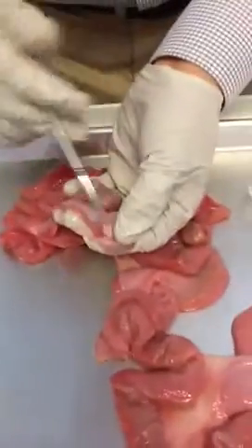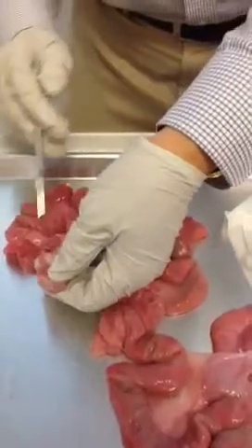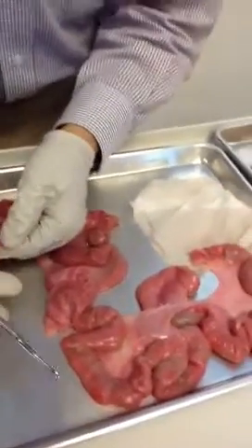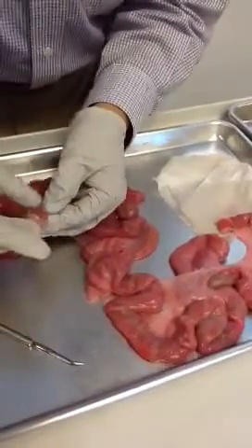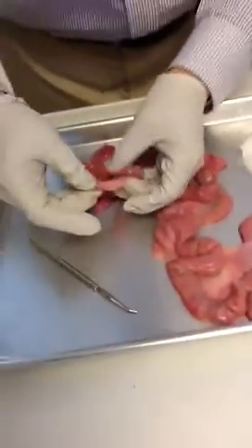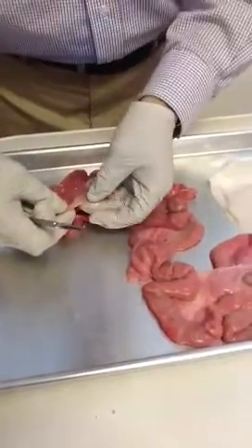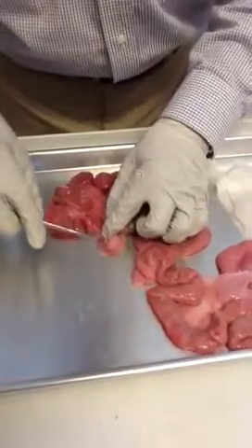You can see the egg is very small — it's always down here. In probably the first part of the uterine horn, they have a chance for fertilization. It's very small. I tried to see if they have a suction structure, but it looked kind of difficult. In the very beginning here, I couldn't see the fimbriae structure. In humans, you will see that. This egg starts to release from here, and it comes all the way down.